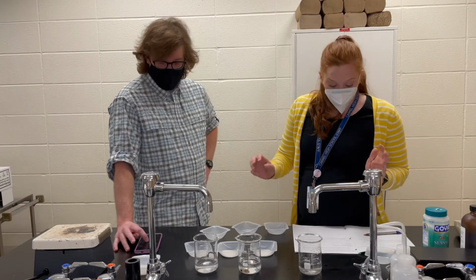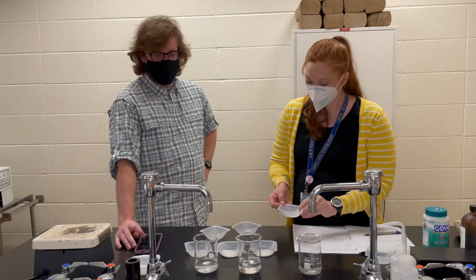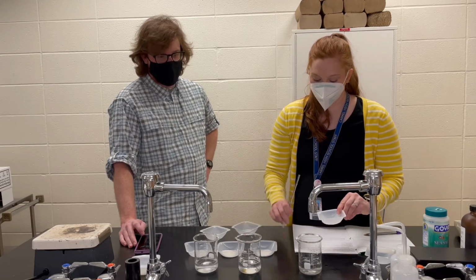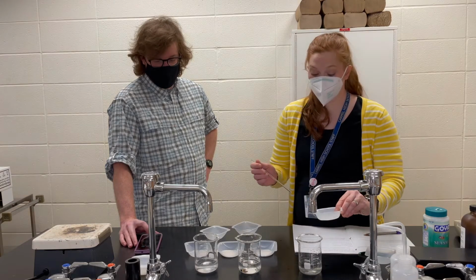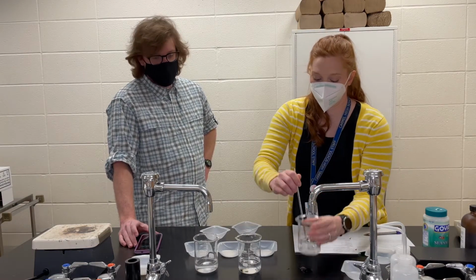All right. How do we want to go? We want to go small to large? Let's go small to large, because that's how our data table is set up. Perfect. So Mrs. Kat's gonna start off with the smallest powder, and you let me know when you're good. Okay, here we go. And our timer is running.